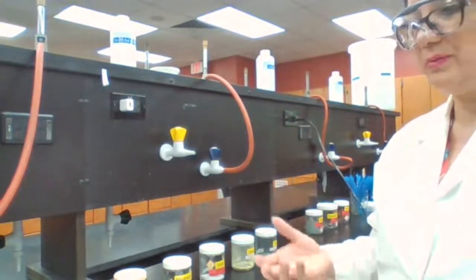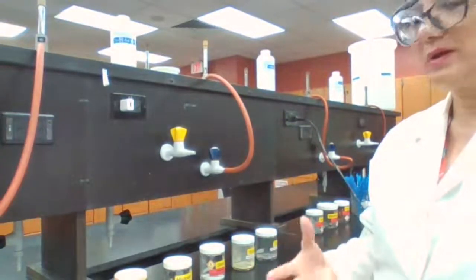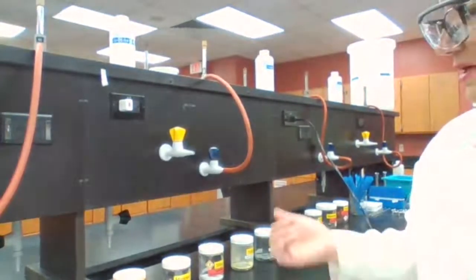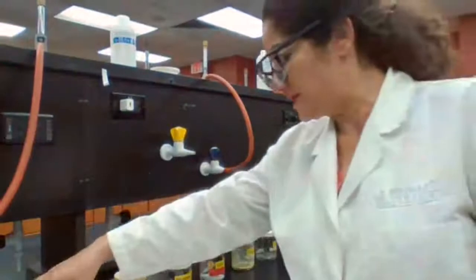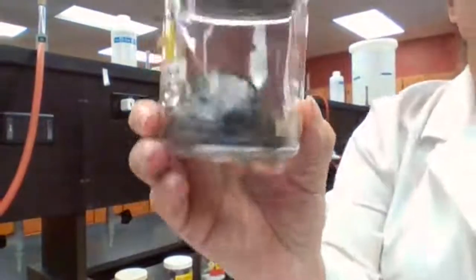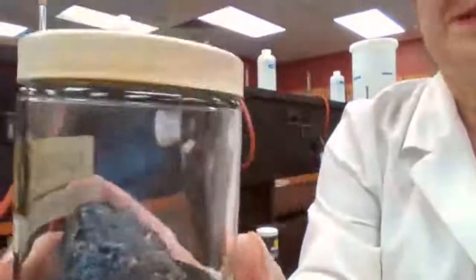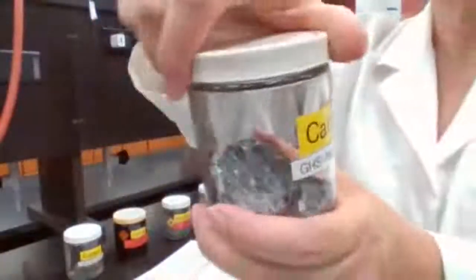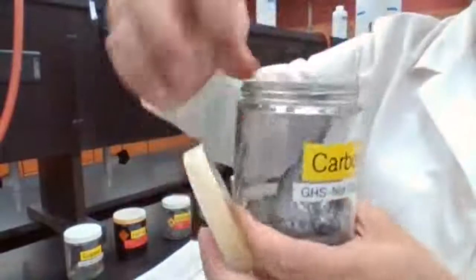What are the common properties for metals? What are common properties for non-metals? So the first element that you have here is carbon. I want you to look at the carbon because that's what you would do if you were in the lab, and I'm not sure that you expect me to do the experiment for you. I want you to do the experiment yourself.